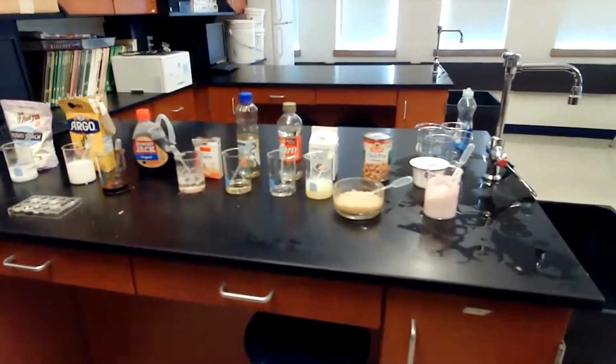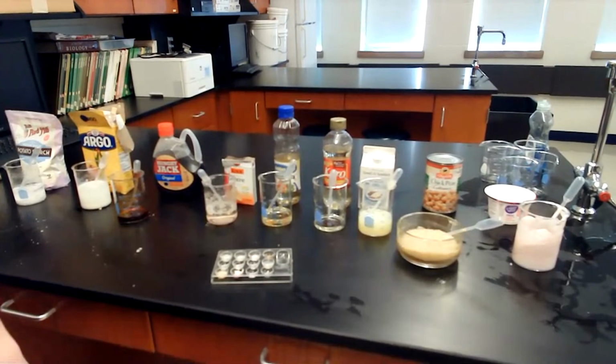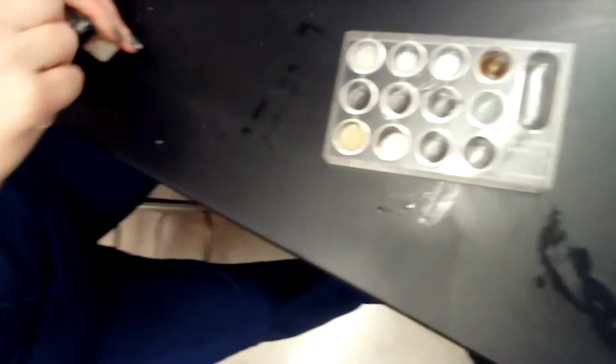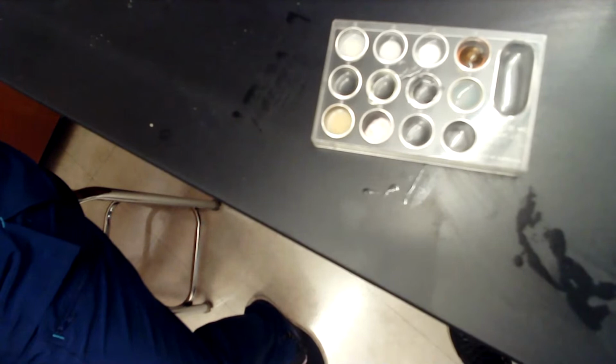Then we'll come over here and we will test our other samples. Move a little closer so we can get a good look at each one of these. Same thing. How many drops? 2, 3, 5. Okay. So should we say which one we're doing each time? Yeah. Not messing with the bottle yet. There we go. Exactly. All right.